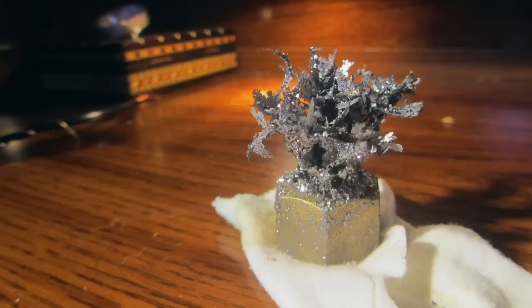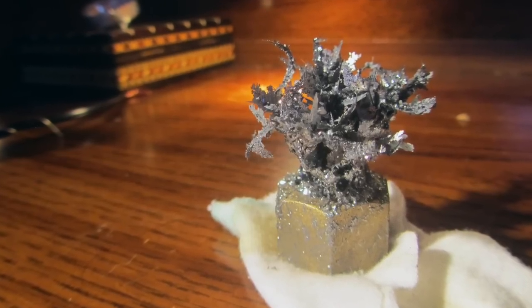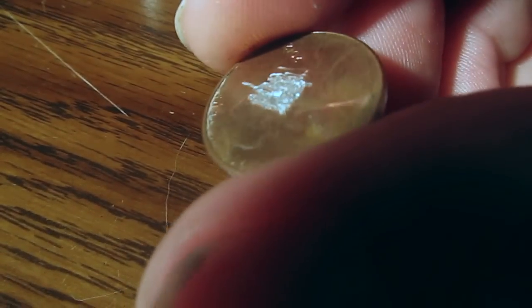Although it does look cool, lead quickly oxidizes in air to form a gray or white coating of lead oxide on it.